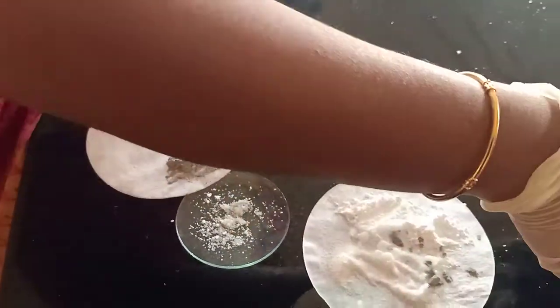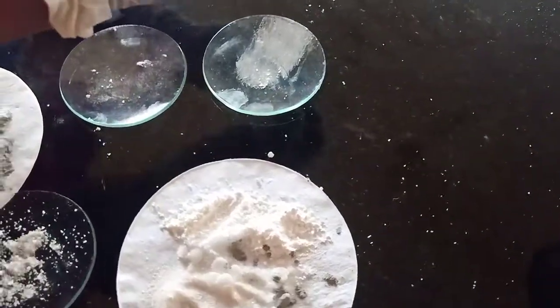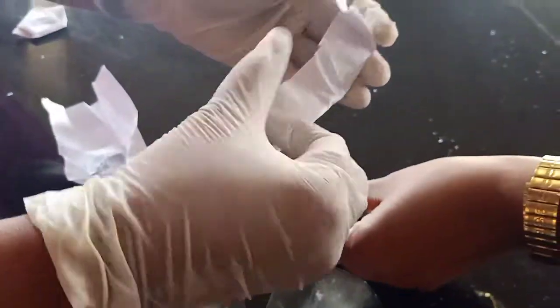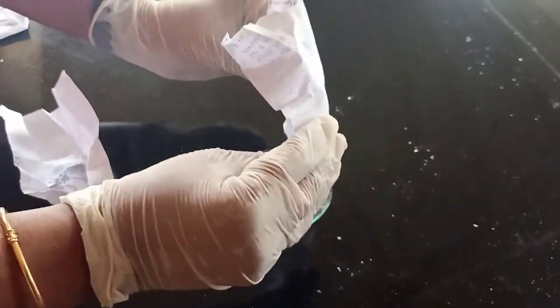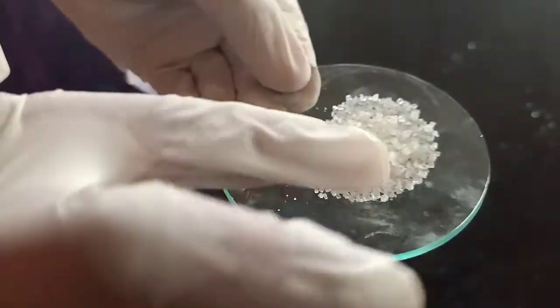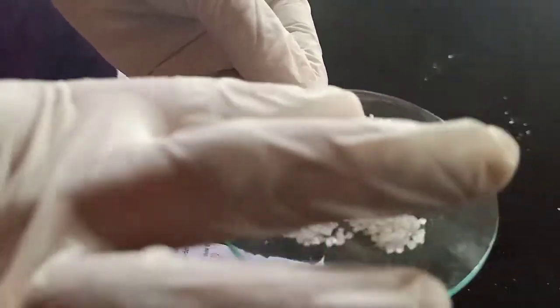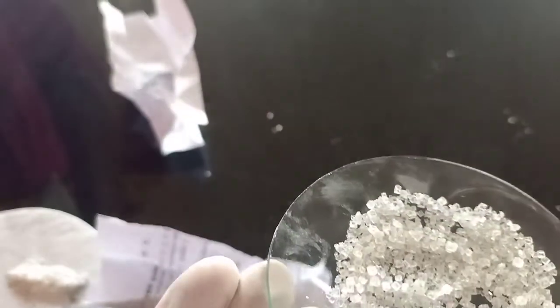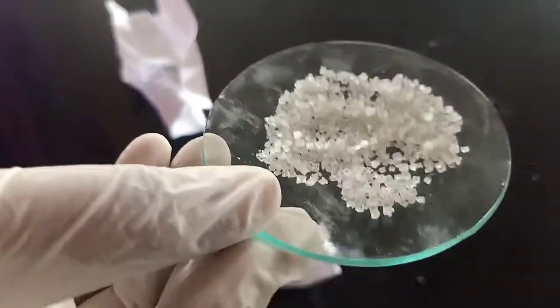Shall we see the next four salts? Ammonium sulfate — any guess how sulfate will be? I told you. See — it is just like sugar. It is some odd dirty white color. This is ammonium sulfate.